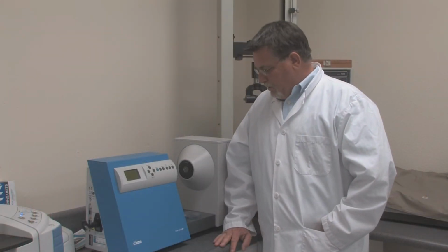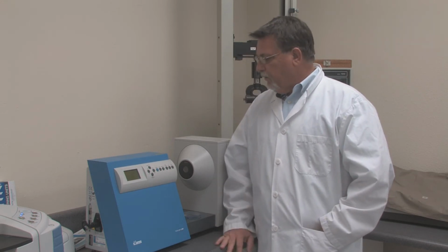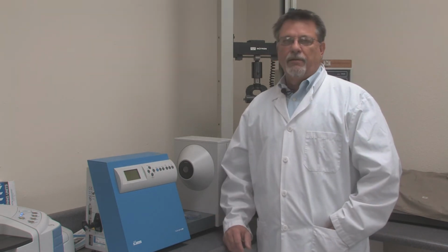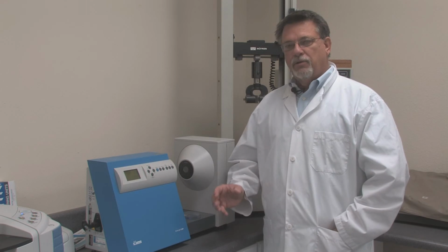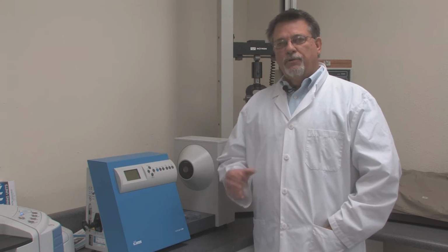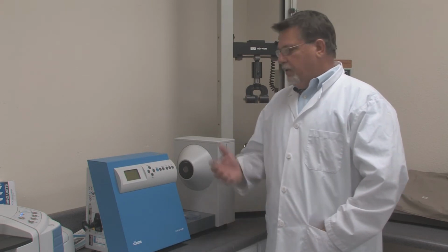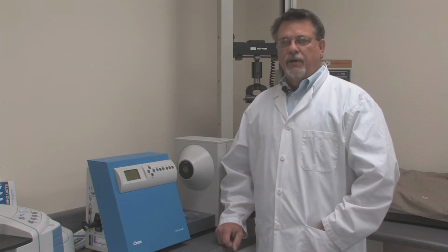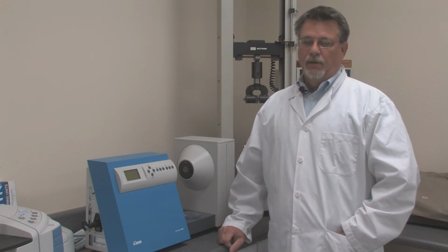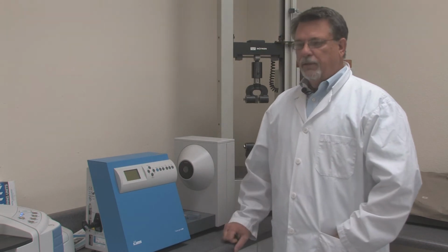Now, this little machine here is what's called a haze guard. It's an optical evaluation device, and what we're looking for here is some of the standard optical qualities of plastics. Haze, transmission, clarity, things like this. In terms of both the base polymers and the materials that we have treated and put special optical coatings on, this device helps us be sure that we're in spec in terms of light transmission and clarity issues. It's a clever little tool and comes in handy when you're looking for the best optical properties of a polymer.